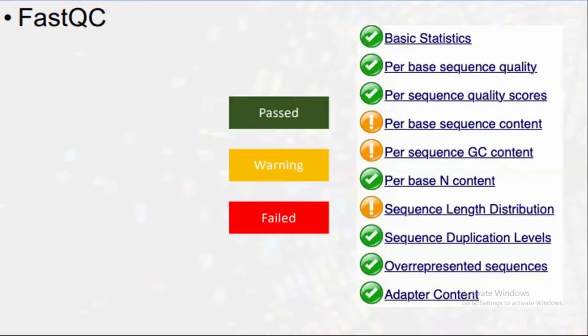The main reason for this video is to make you understand what these FASTQC reports basically tell us. When you interpret them well, you can easily pre-process your data, remove the failed or warning regions, and make them green. This is very important.